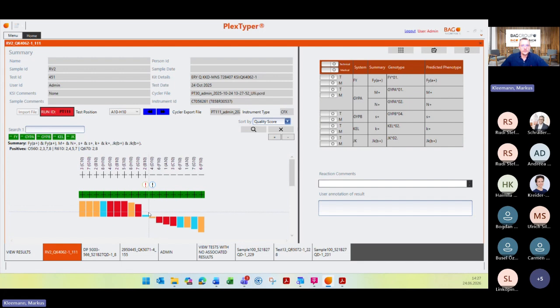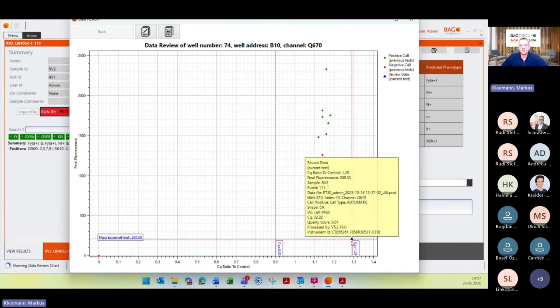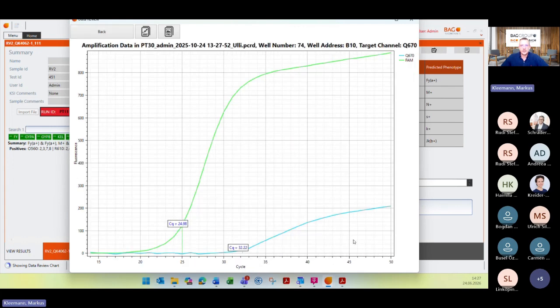The more critical one, and I also want to point out that you have to look at these critical warnings where it says close to threshold. And what you can see here when we double click on this one, is that this reaction is located quite here in this corner, directly on these two different borders. When I double click on this reaction, you can see, okay, here is my internal amplification control, which is almost there with a CQ of 24.98. And then there's a slight increase here in blue for your target, but you have this CQ here.